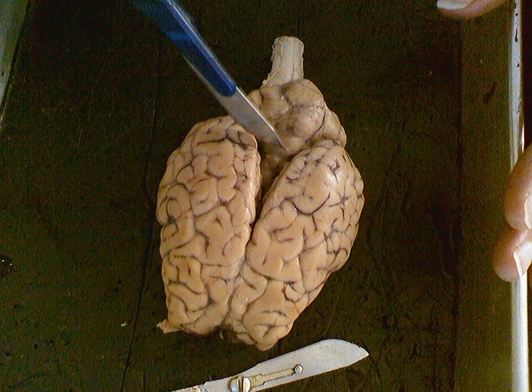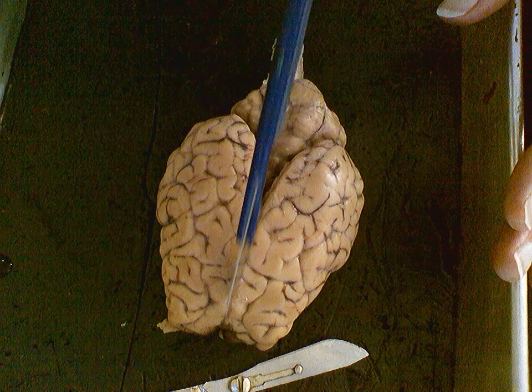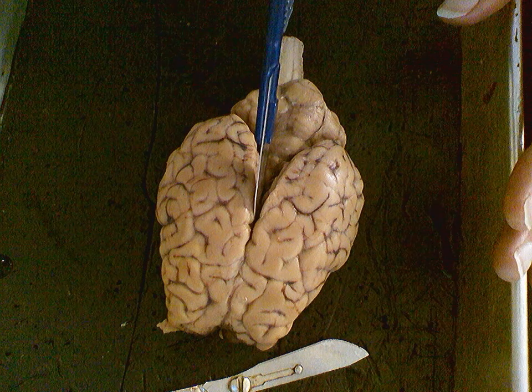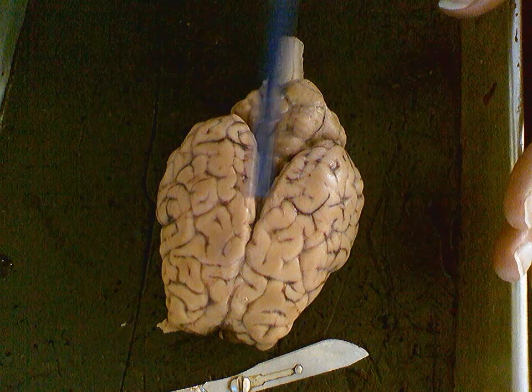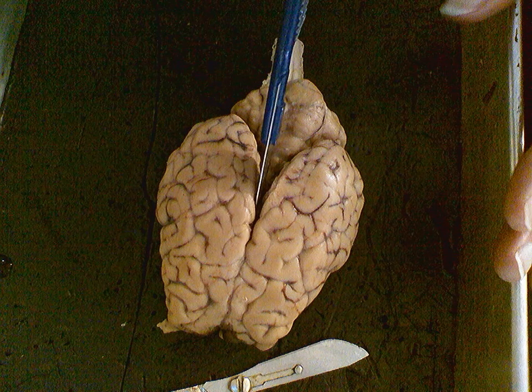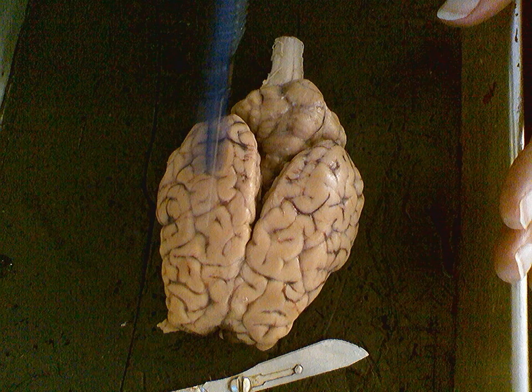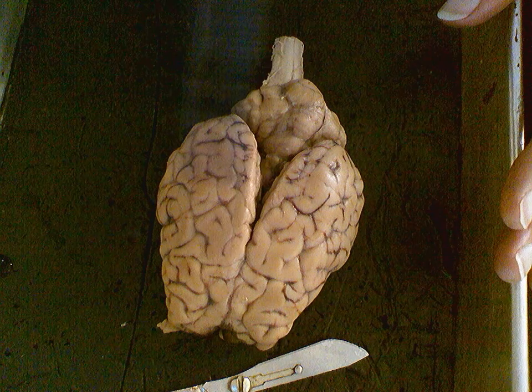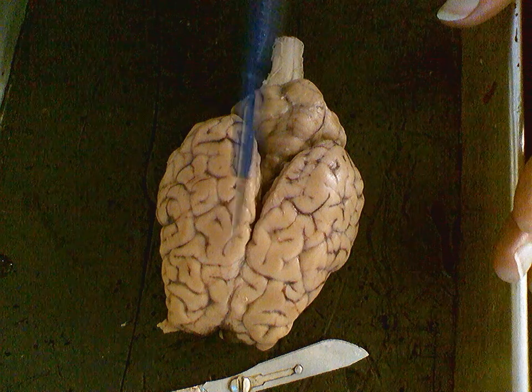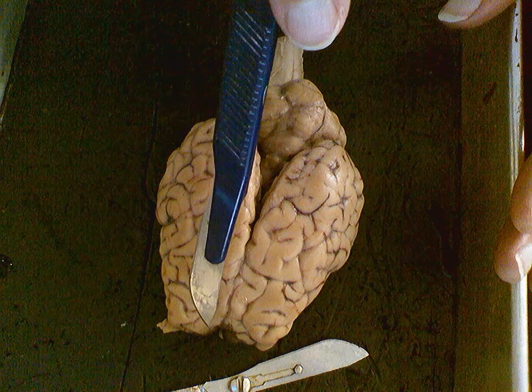We can also talk about the brain in terms of position when we look at structures relative to one another. So from the whole brain perspective, we see that this medial area right here, meaning right down the middle, medial area is here. And then on either side of the medial area, we can call that lateral. So we have medial, lateral, we have anterior or rostral, and we have posterior or caudal.